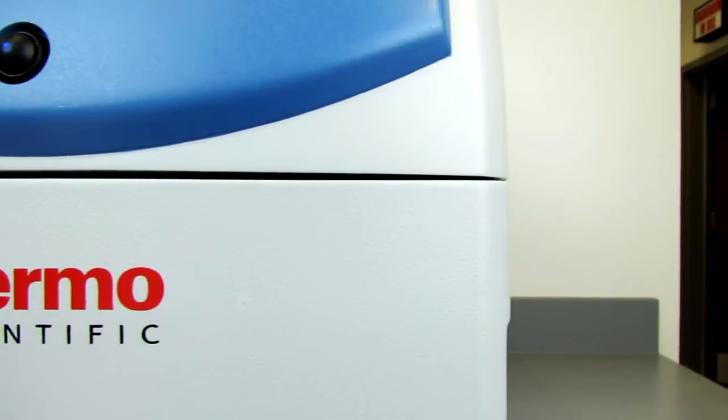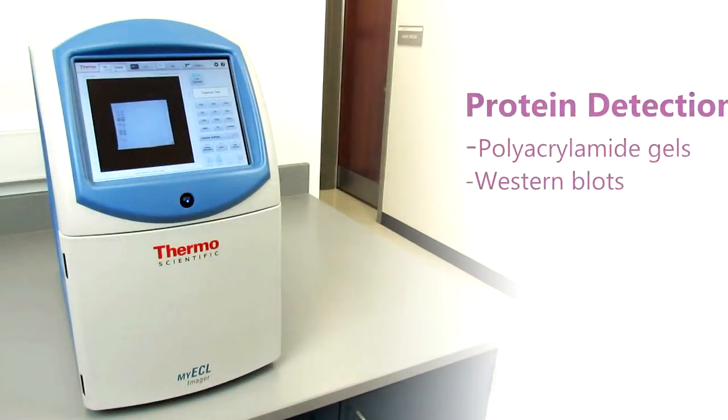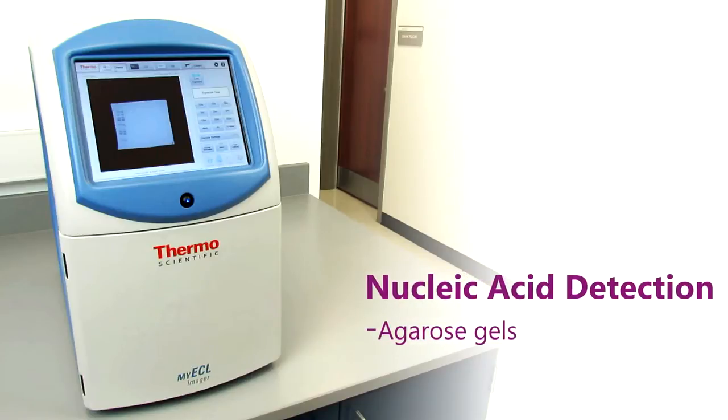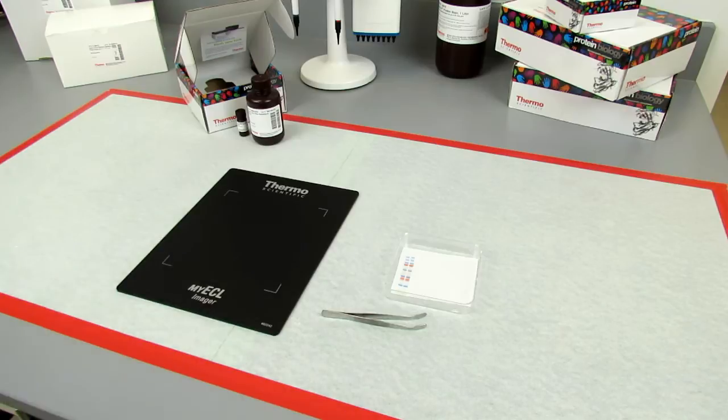The Thermo MyECL Imager is a standalone platform for one-touch imaging of polyacrylamide gels and Western blots for protein detection and agarose gels for nucleic acid detection. Let's look at capturing chemiluminescent Western blot images.